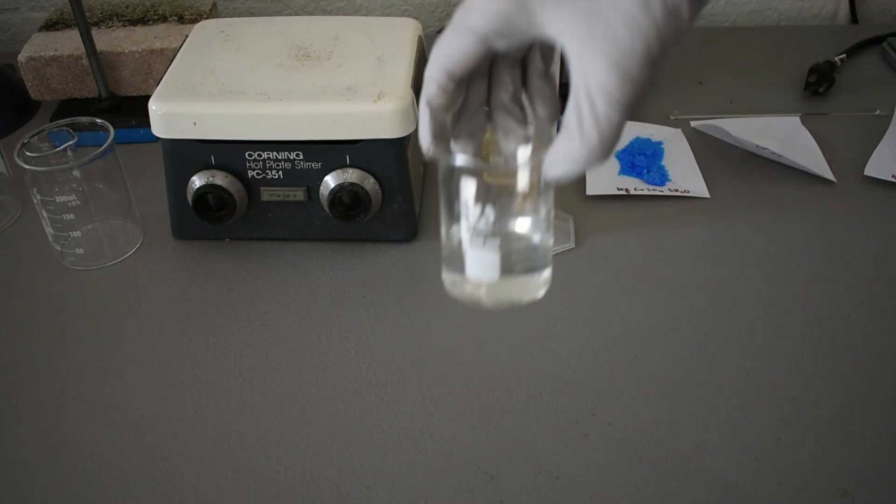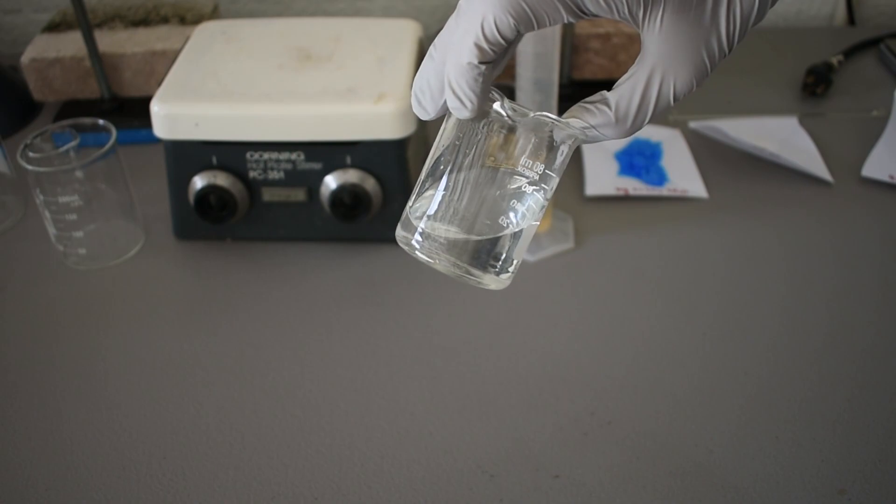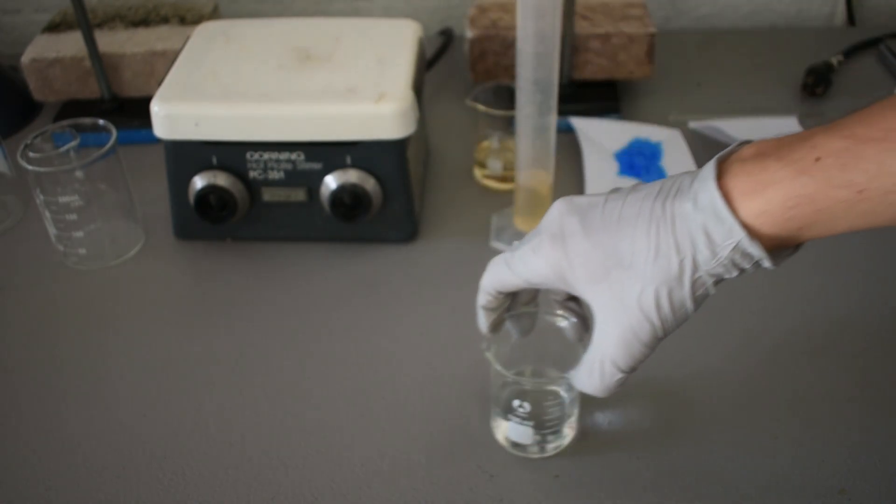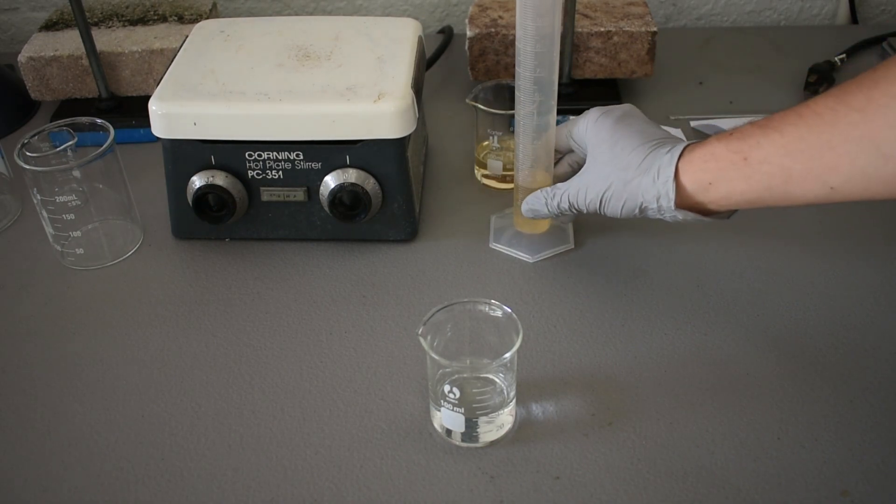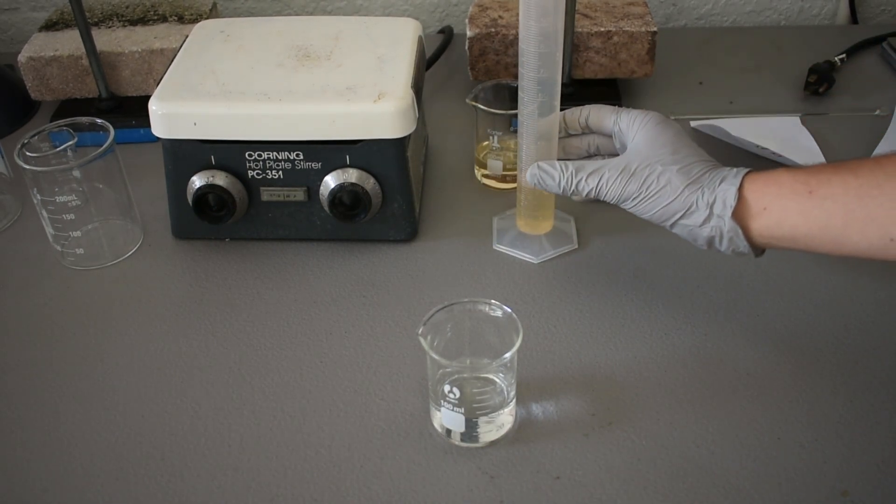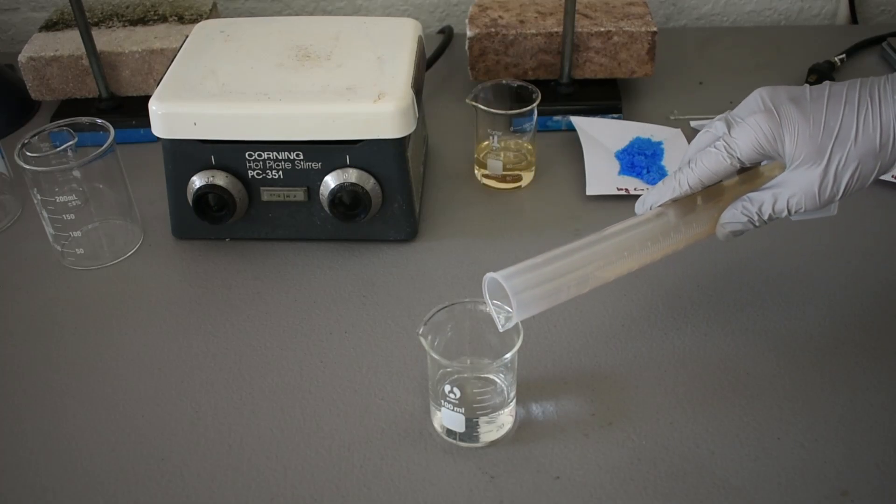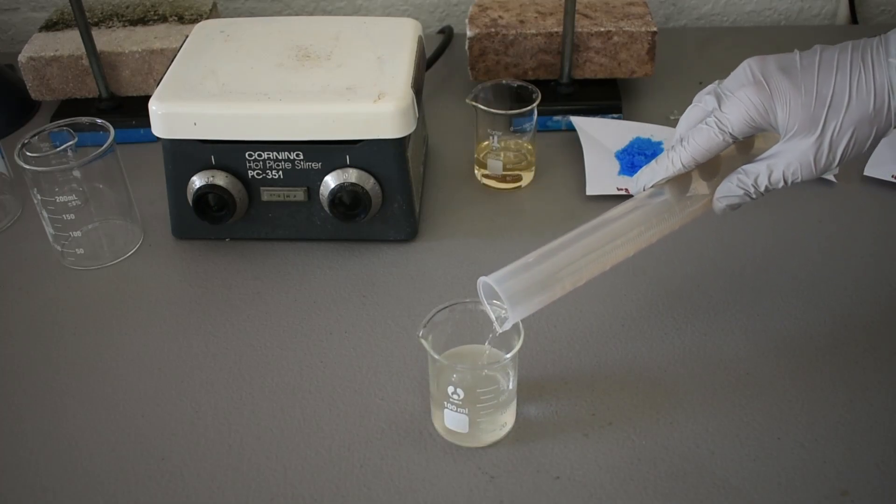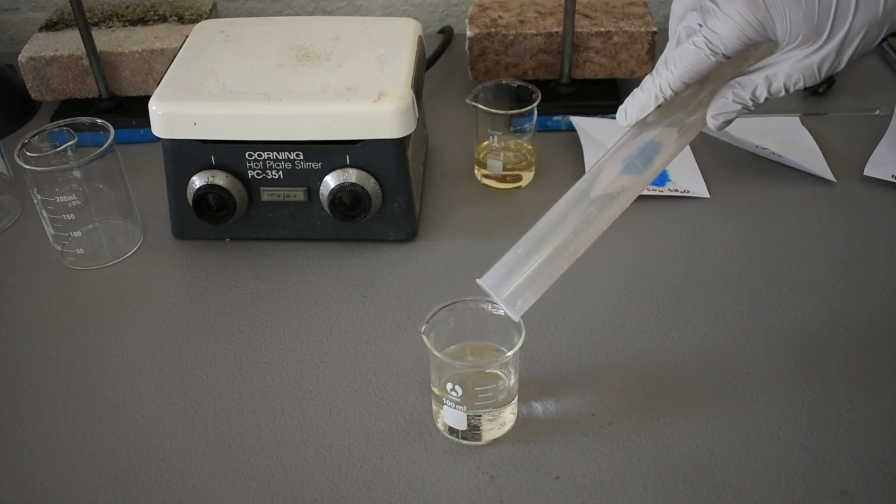Our sodium sulfite is now in solution. Camera will focus. So now we're going to add 20 milliliters of our dilute, approximately 15% sulfuric acid. There we go.